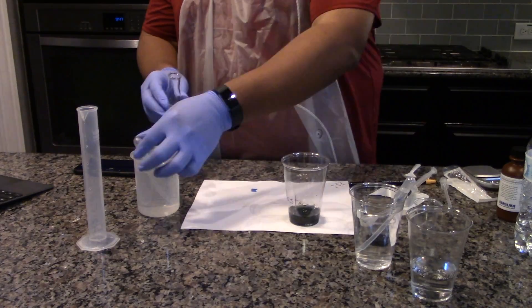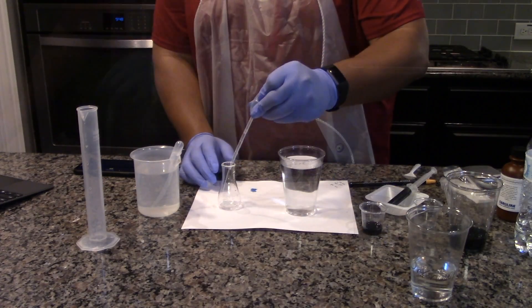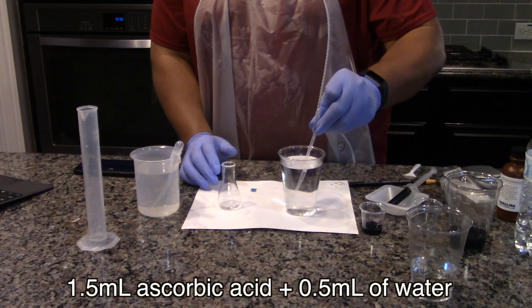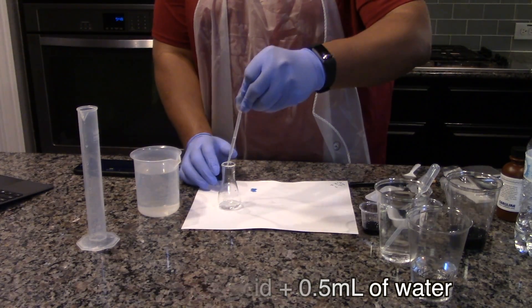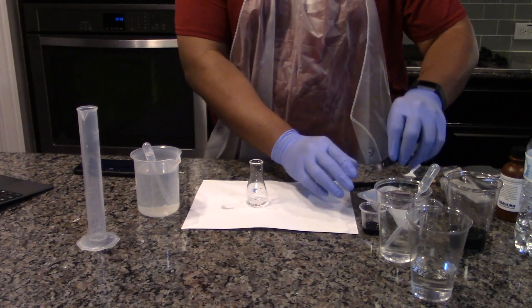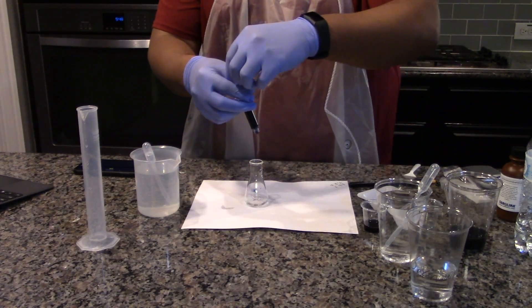Empty and rinse the flask with pure water. Record the final volume of the solution in the data table. Perform the titration for the 1.5 grams per liter ascorbic acid sample. Transfer 1.5 milliliters of ascorbic acid stock solution to the flask and add 0.5 milliliters of pure water to the flask. Follow the same procedure as the other titrations.